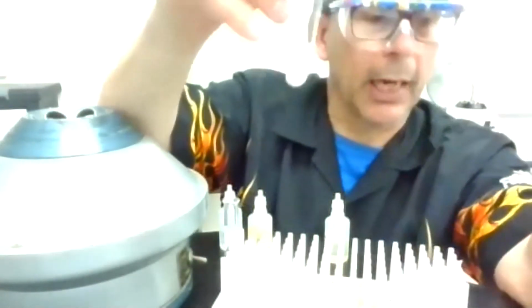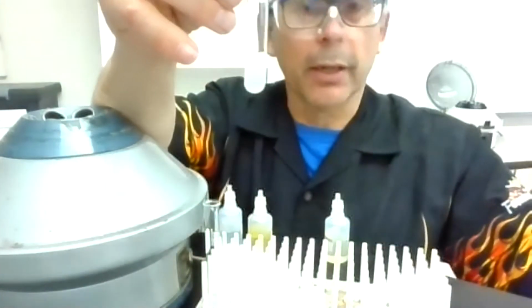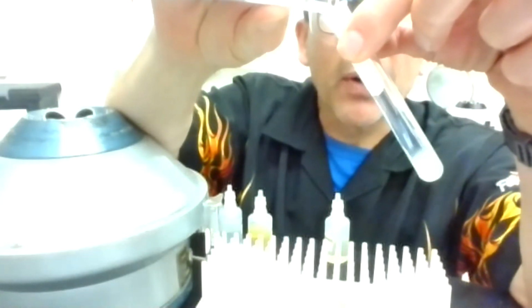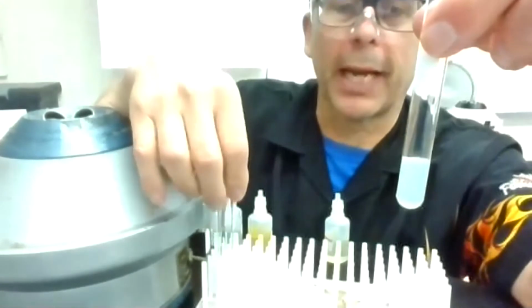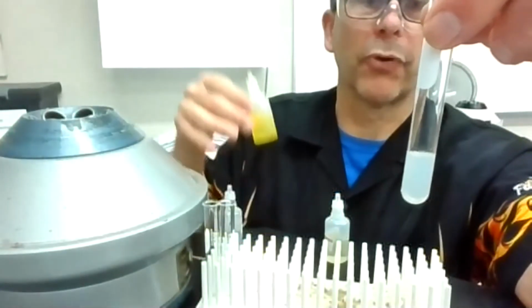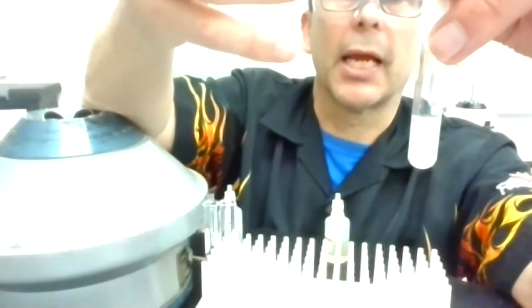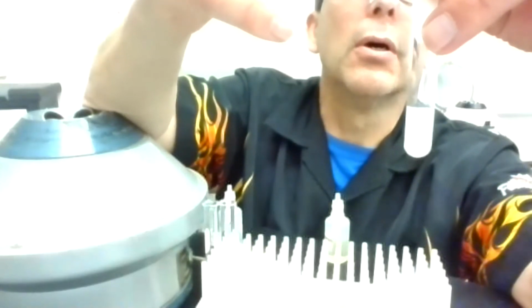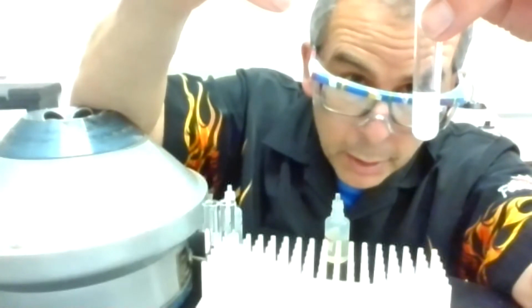Yeah, a little bit more came to the bottom, not much. So it's a little bit hard to tell. And on video, it probably looks pretty cloudy. It's not too bad. I can kind of see through that. But there's definitely some haze there. So what I'm going to watch for in my next step is, does that haze stay the same, increase, or decrease? Or I'm sorry, does it stay the same or increase probably.